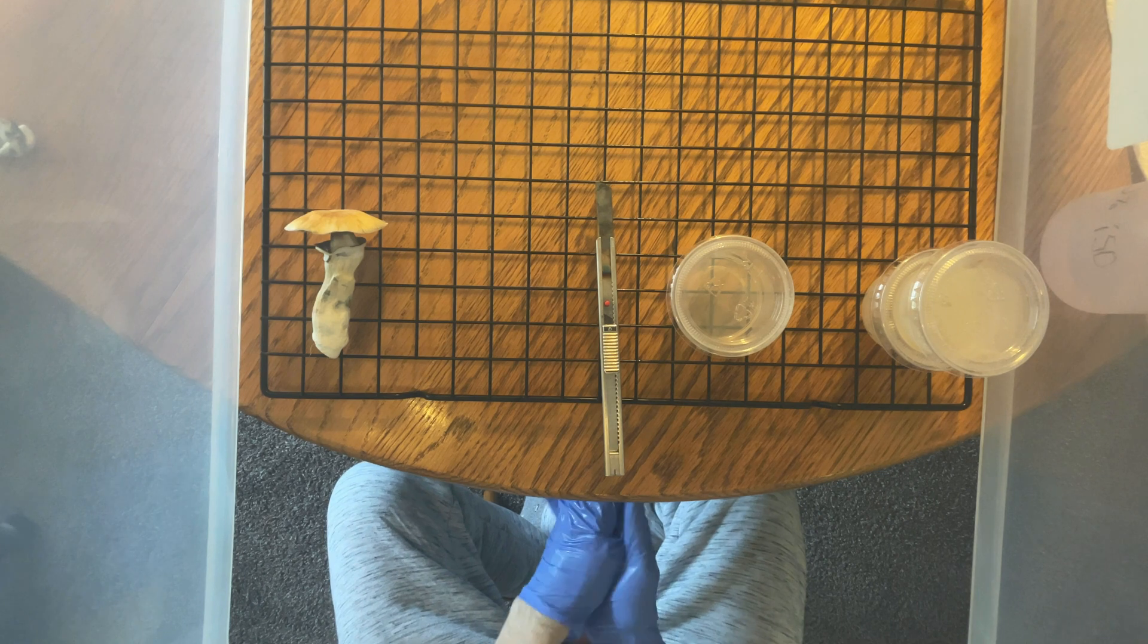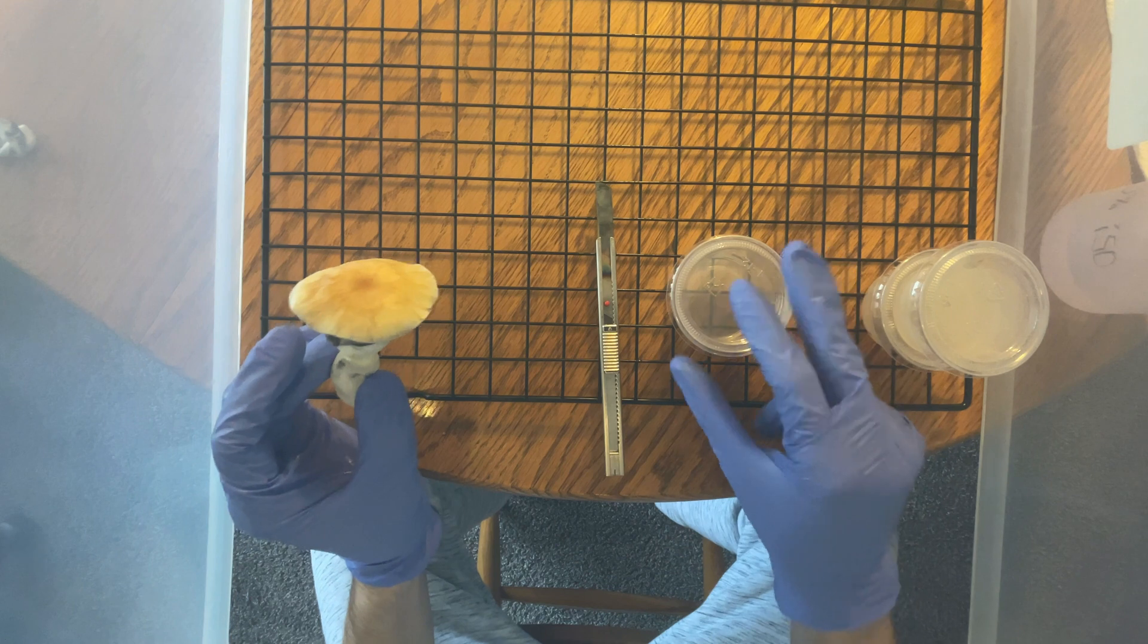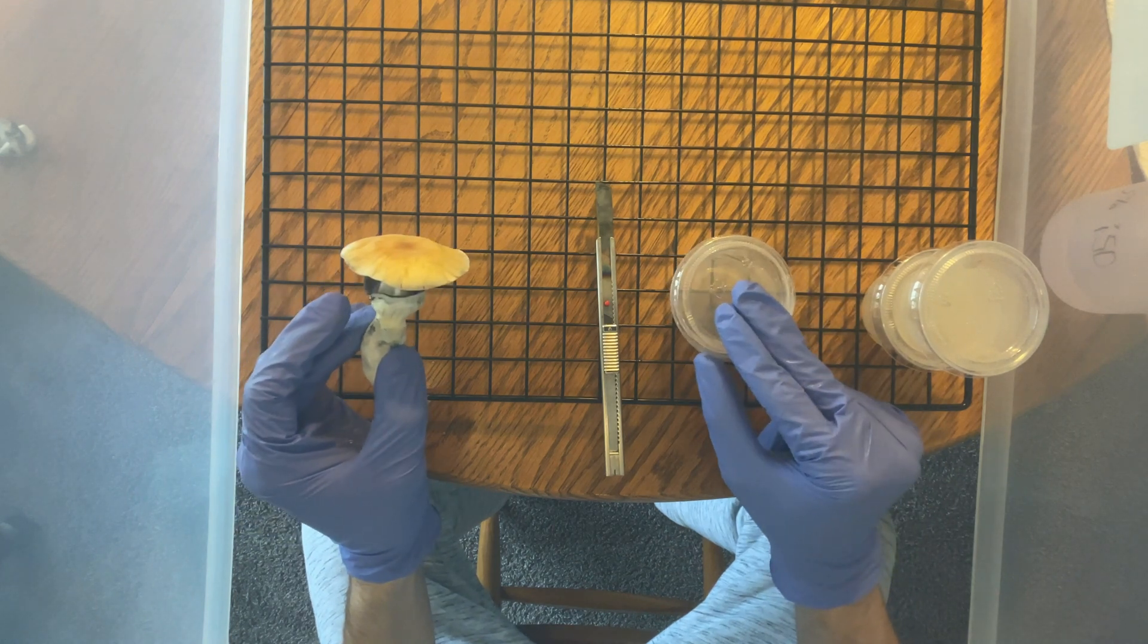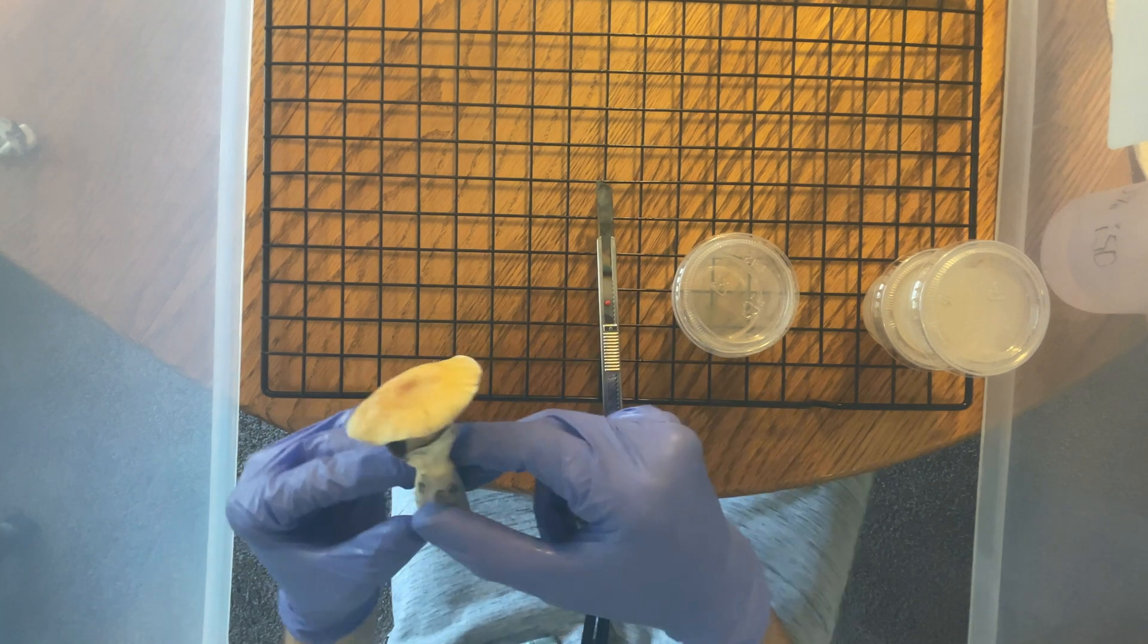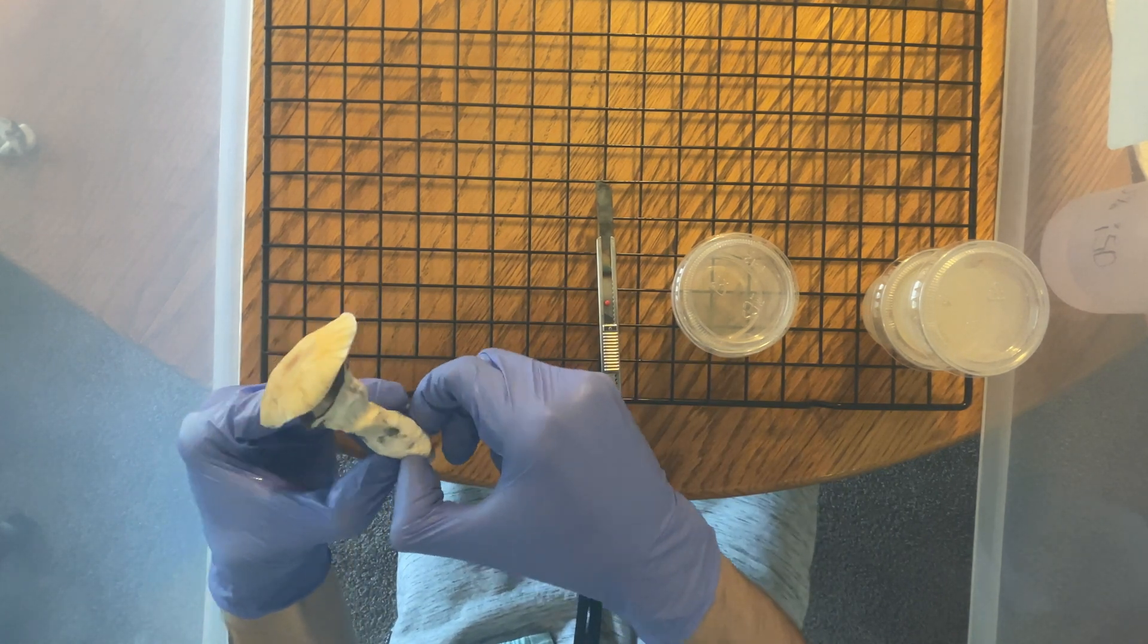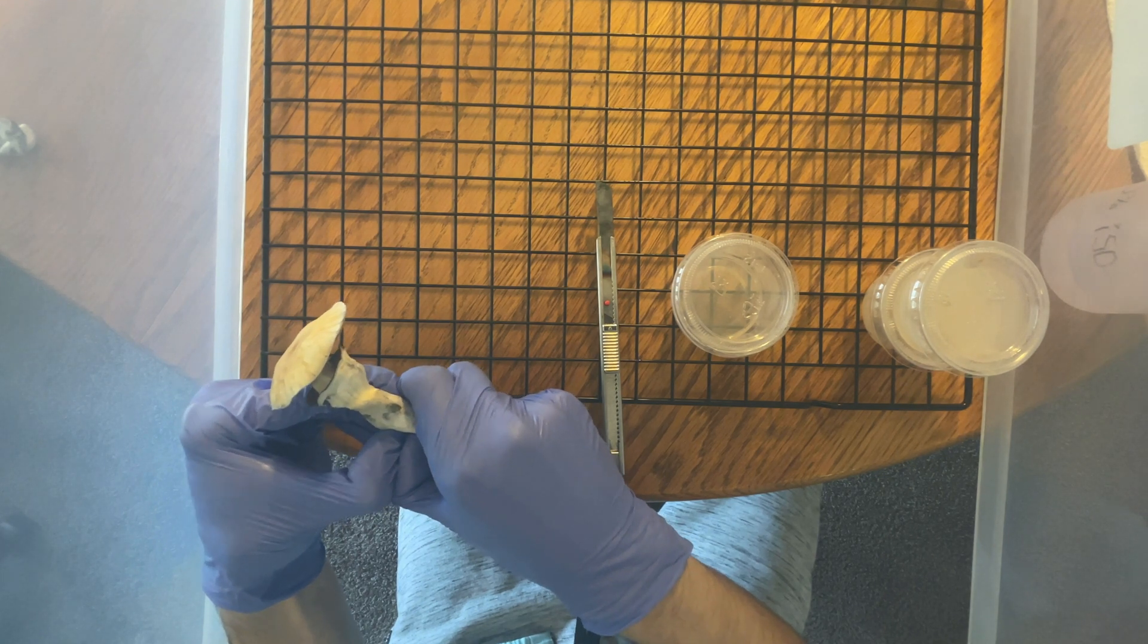All right, so one more time with this lighter cap on. I would just like to note that it's a lot easier to pull a layer away from the stipe on these ones when they're a lot longer, as opposed to the thick and squatty fruits.